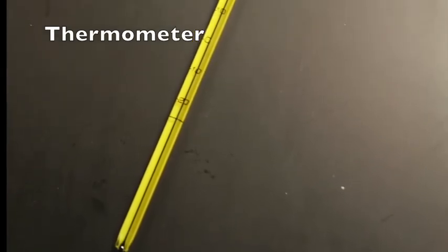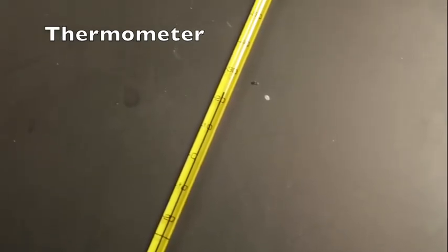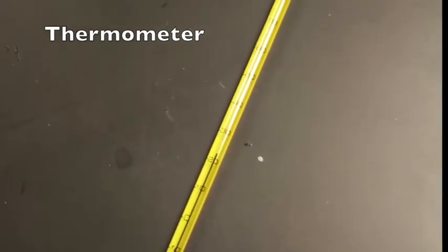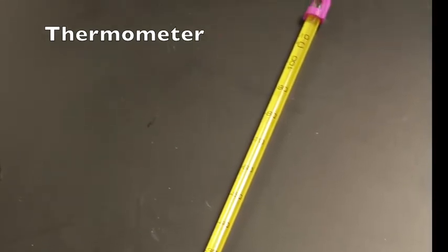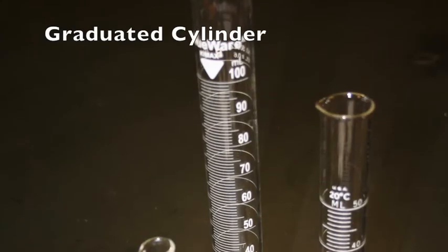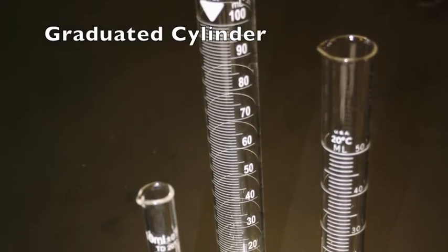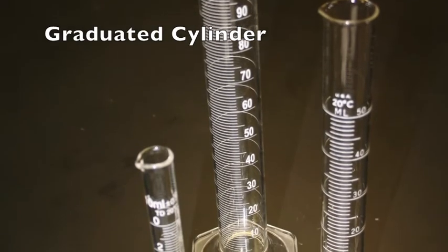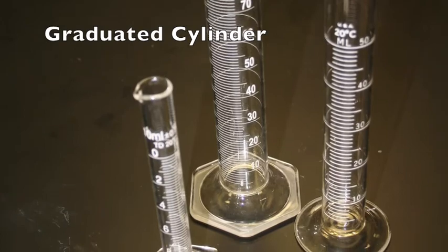The thermometer is usually a liquid-filled tube of glass in which the liquid expands as temperature increases. Thus, it is used to measure temperature. Other types of thermometers are available in the form of electronic probes or infrared detectors. Graduated cylinders are used to measure liquid volume and are made in a wide variety of sizes. Shown here are 10, 50, and 100 milliliter graduated cylinders.